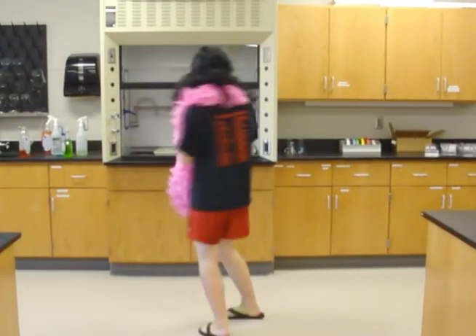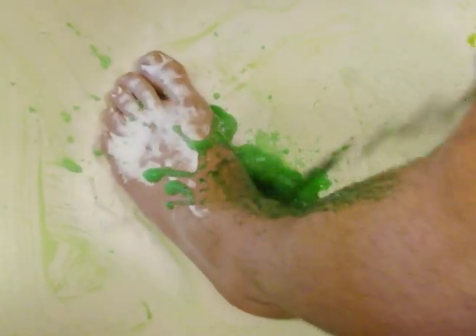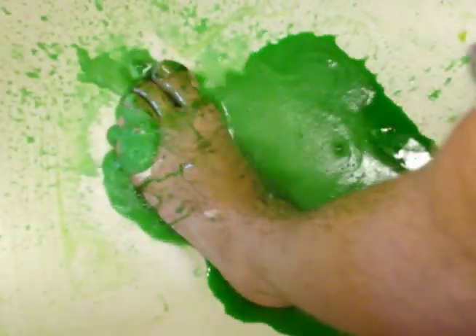Long pants and closed-toed shoes, cause chemical burns make bad boo-boos. An apron protects your lower half, just in case your chemicals splash. With untied hair or baggy attire, you may find yourself on fire.